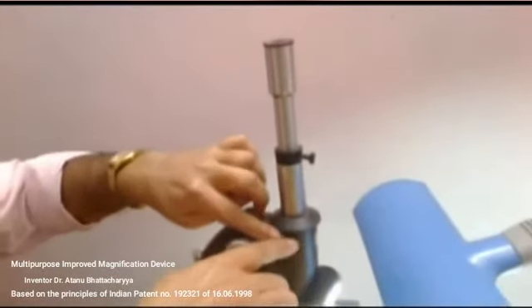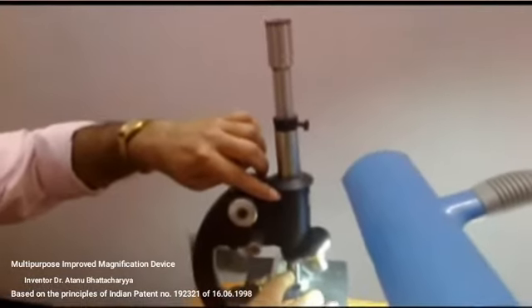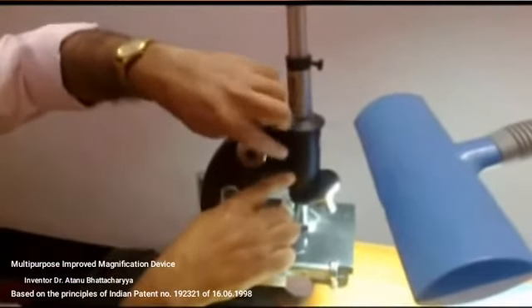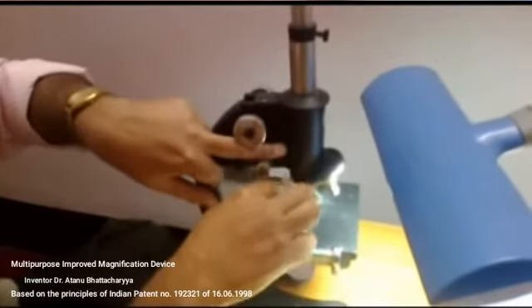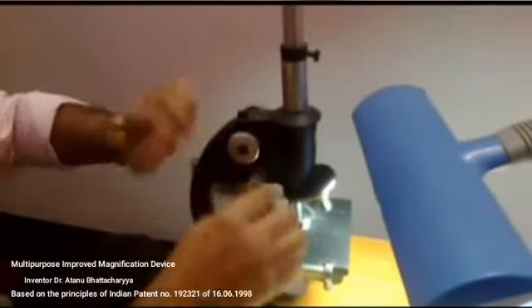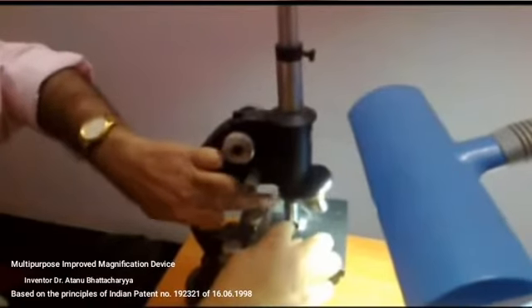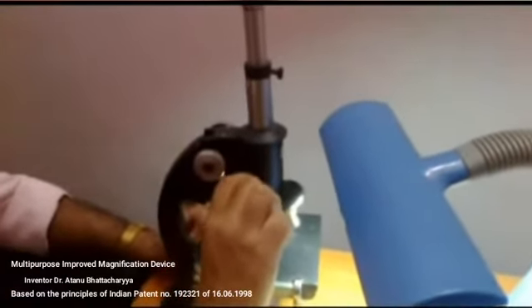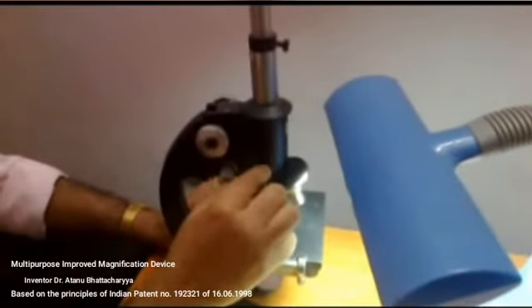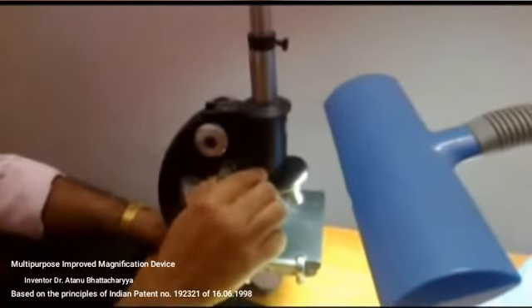Now if I wish to reduce the image, then what do I have to do? Then I have to push the tube into the microscope. After pushing the tube, this objective comes at a lower position. Then this objective has to make the image at this position, actually behind this objective. That means the image distance from the lens becomes reduced, and for that adjustment I have to increase the distance from the object to objective. That means the image distance from the lens is reduced and the object distance from the lens is increased, and that is why the magnification of this image becomes lower.